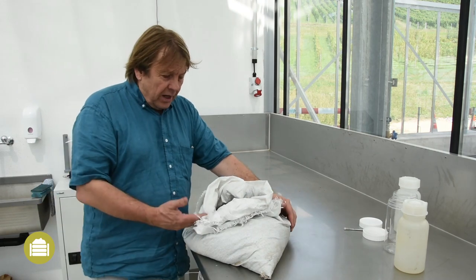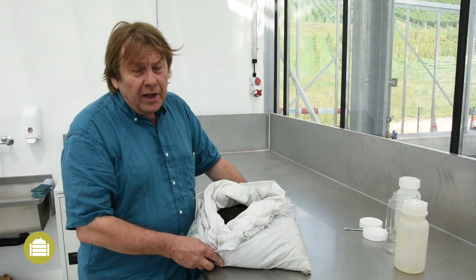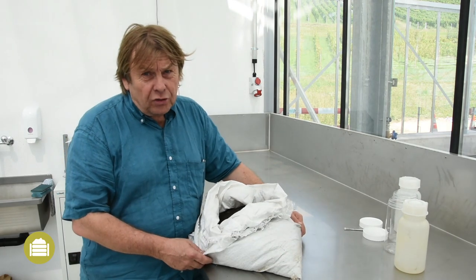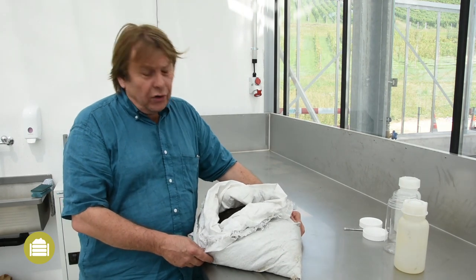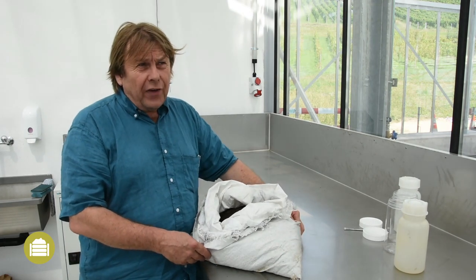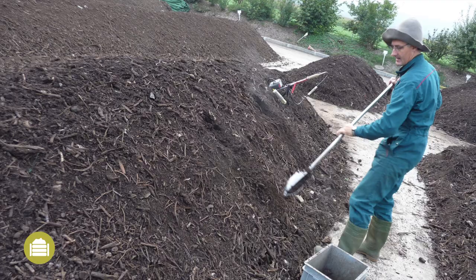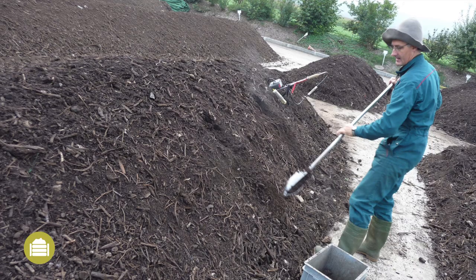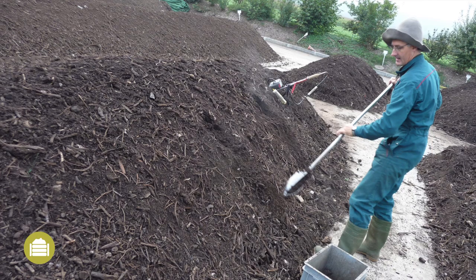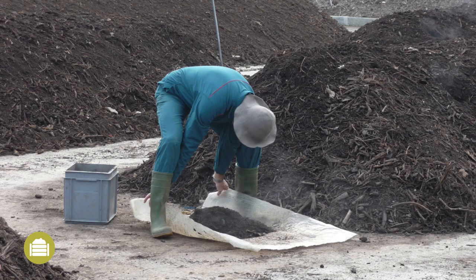I have here a compost sample. It is very important that the sample is homogeneous so it represents the entire compost heap. Therefore, sub-samples have to be taken from the entire heap and then be thoroughly mixed before analysis.